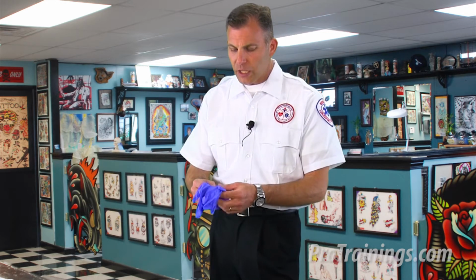We also want to make sure that we've got the right kind of cleaning material, wiping material. You don't want to use toilet paper that's going to shred, or maybe household napkins. They tend to break down with fluids, and that's not what we're looking for. We're looking for maybe a more commercial grade paper towel or something that's appropriate to wipe up these spills. So let's go ahead and get started.